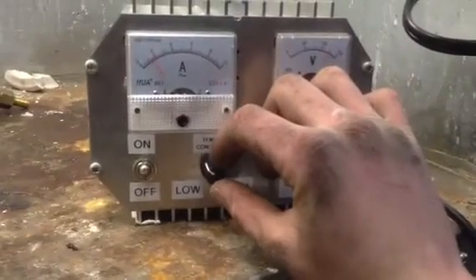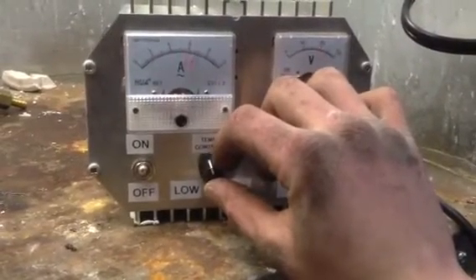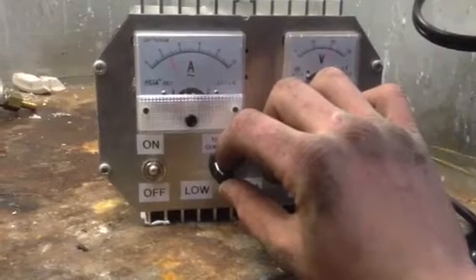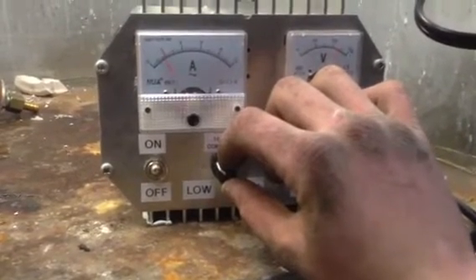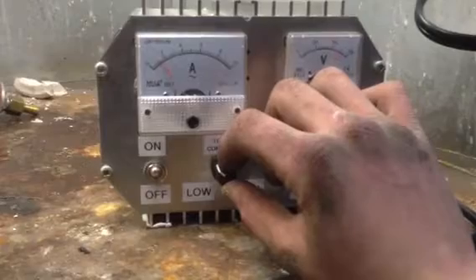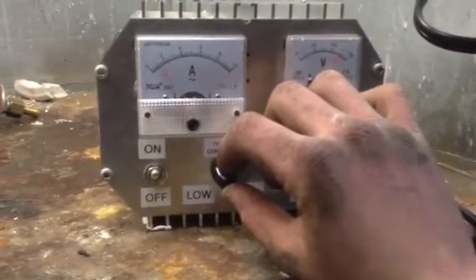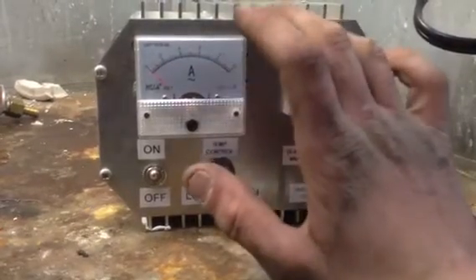So basically you got your little dial here, the more amps you run the hotter it is obviously. One fault with this I'm going to say right now is it's got a dropout current of about 1 amp so below 1 amp it completely shuts off itself.